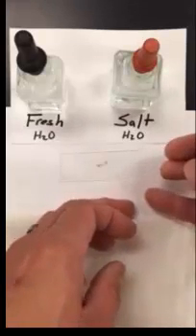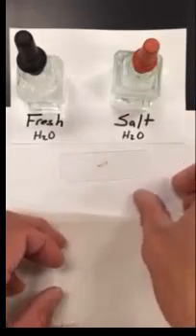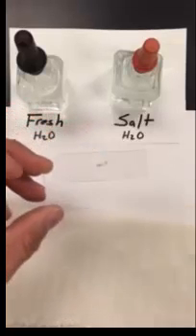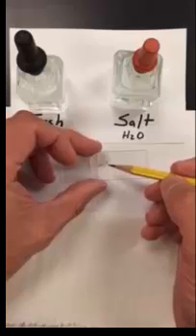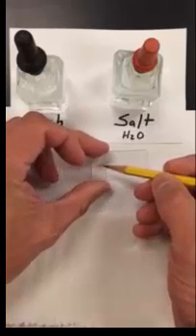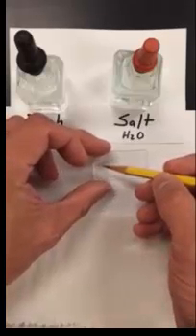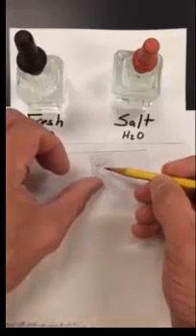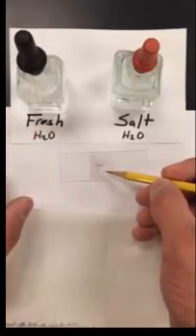Once you have your specimen on the microscope slide you want to take your cover slip and you're going to want to lower it down. So the best thing to do is to kind of stand it straight up at first and put it onto the microscope slide so it's touching and start to lean it on your pencil or pen gently and you take your pencil or pen and slowly lower it down onto the slide.